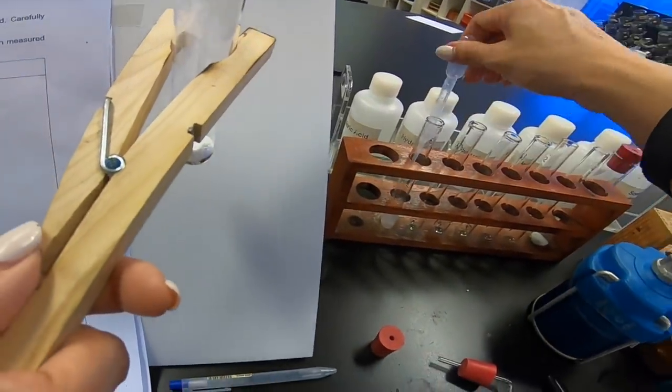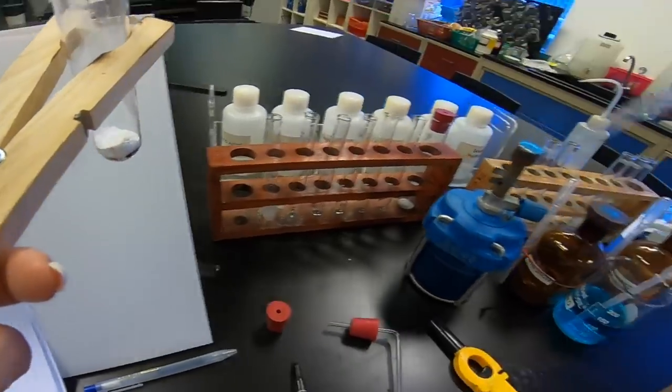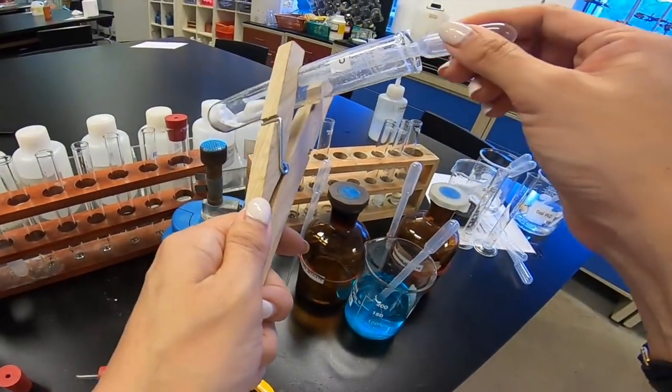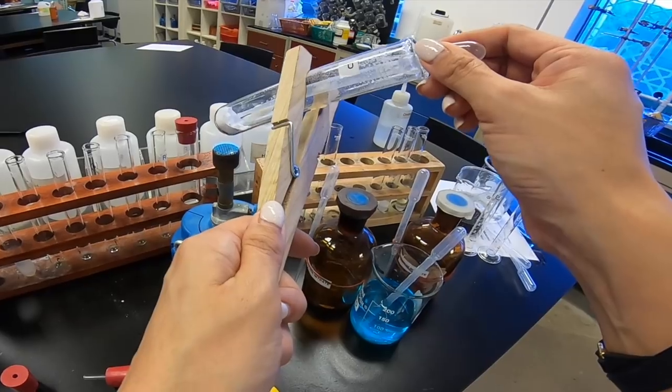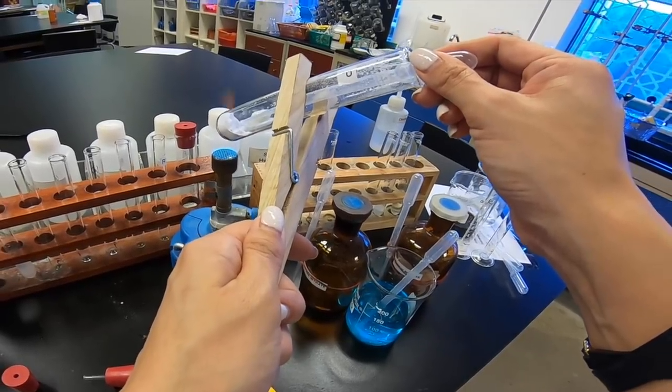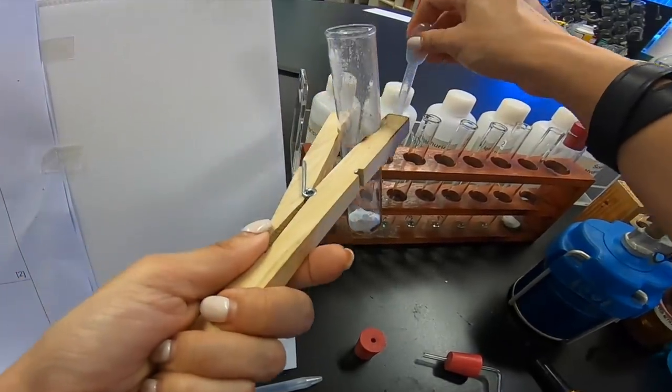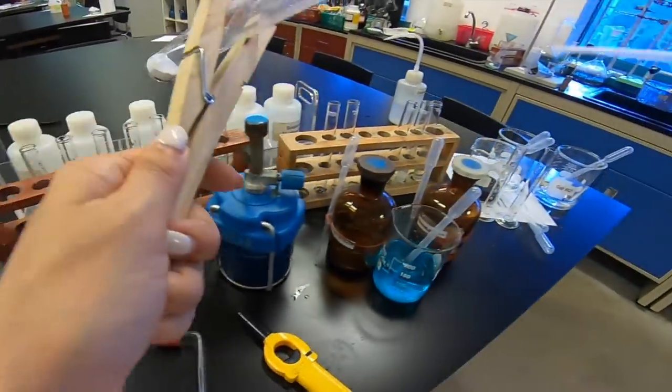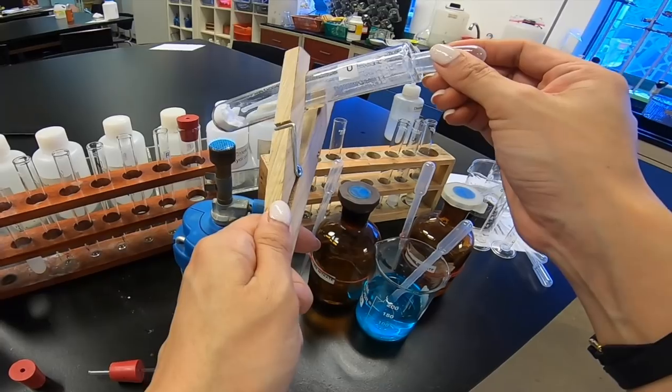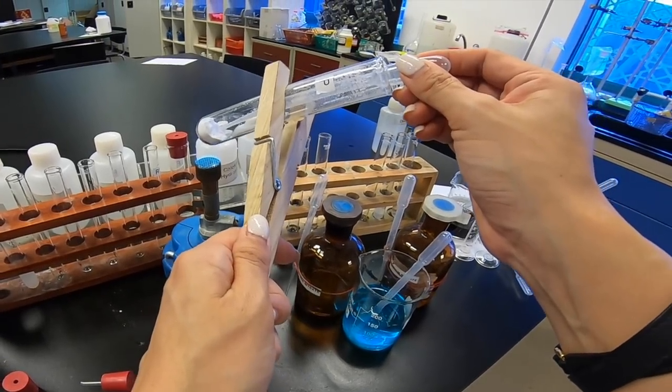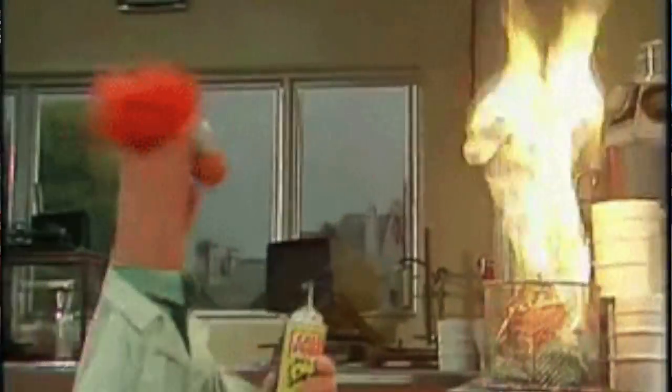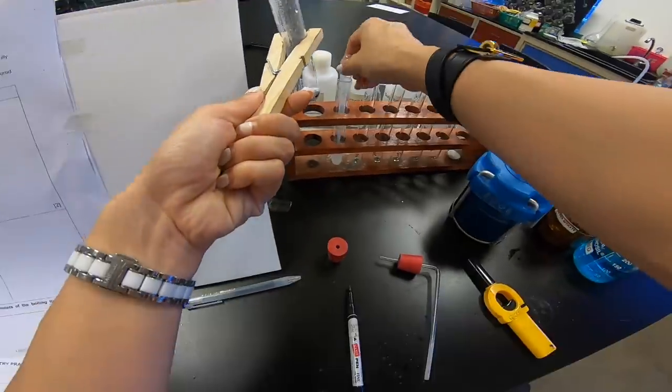But we are supposed to do this for about a minute. So, I'm going to follow the instruction and do it about a minute. But, of course, in the exam, if it's already turned to white PPT immediately for the first time around, you can just stop. So, we're going to repeat this for about a minute.